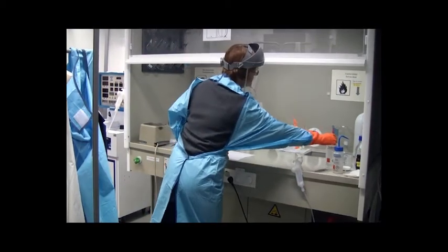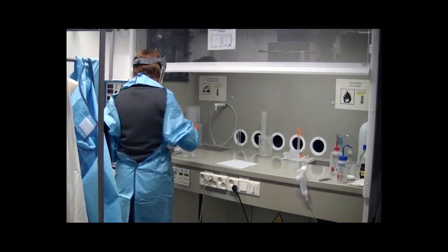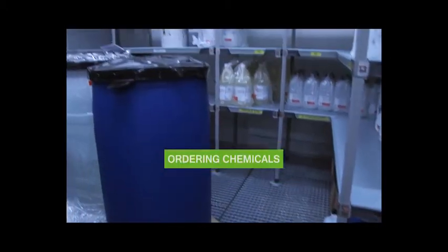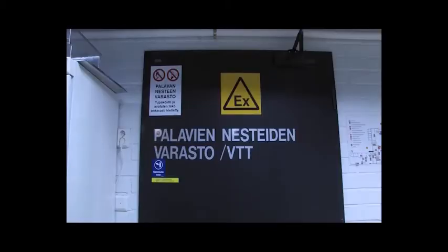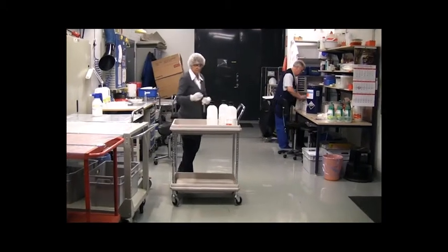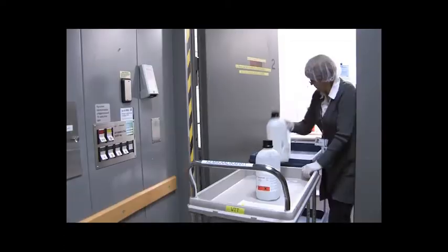With the permit in place, you will receive instructions on using the chemical and handling the chemical waste in the cleanroom. Basic chemicals are ordered in large batches and are stored in chemical storage rooms below the cleanroom. Nanofab staff will take care of transferring these chemicals into the cleanroom via the lift hall at the rear of the cleanroom.